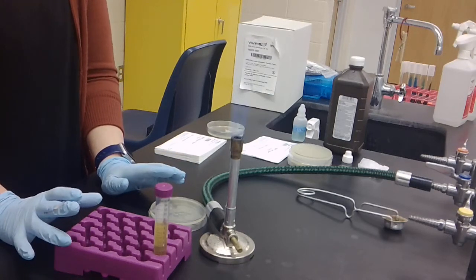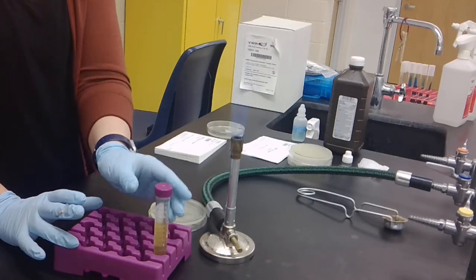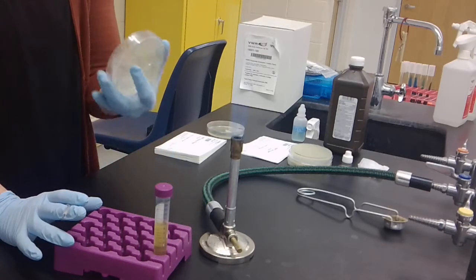So in this video, I'm going to show you how to aseptically transfer bacteria from a broth culture to a plate.